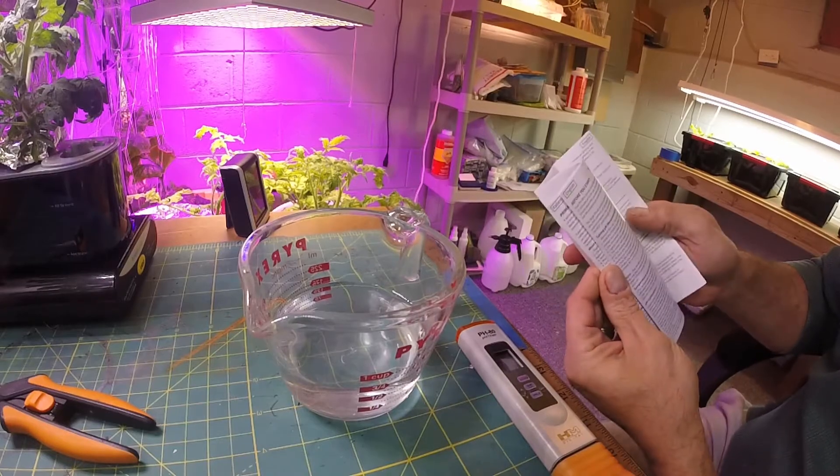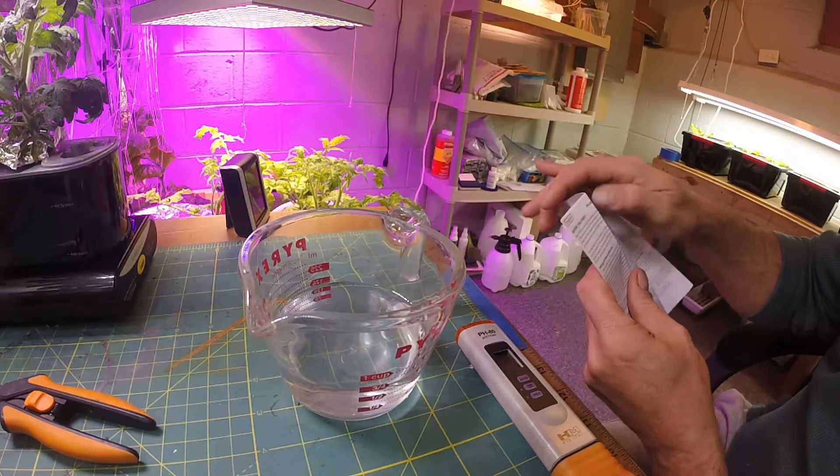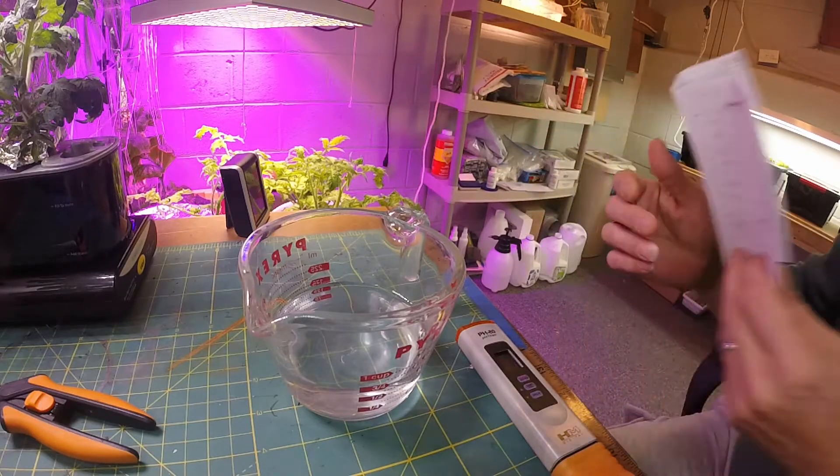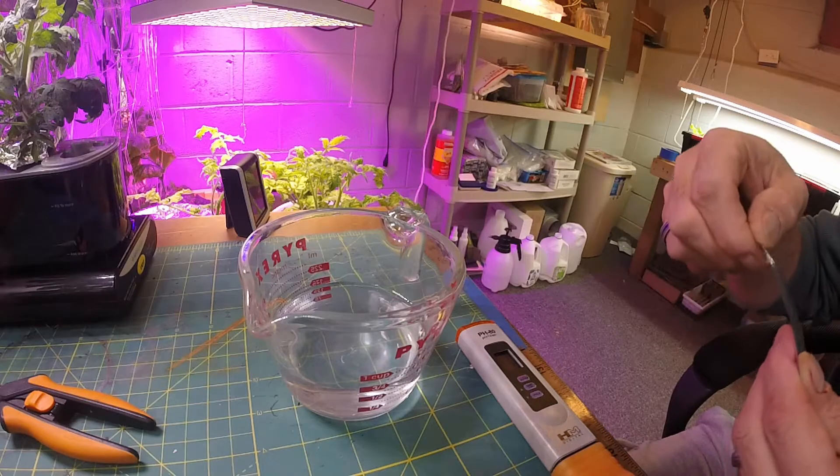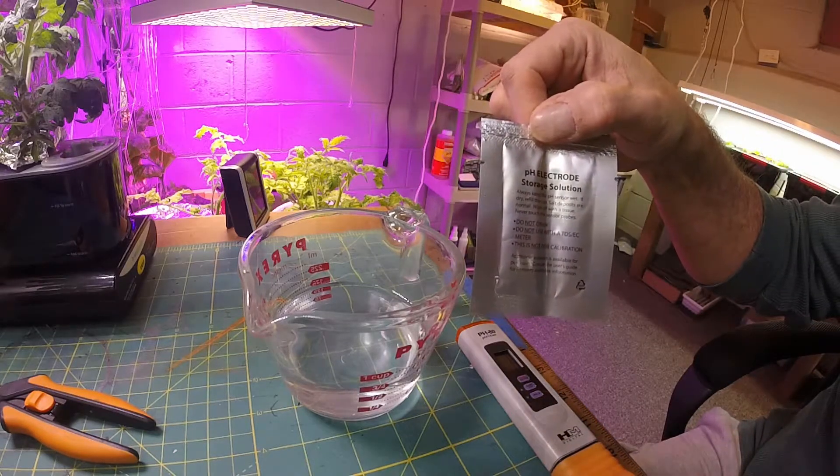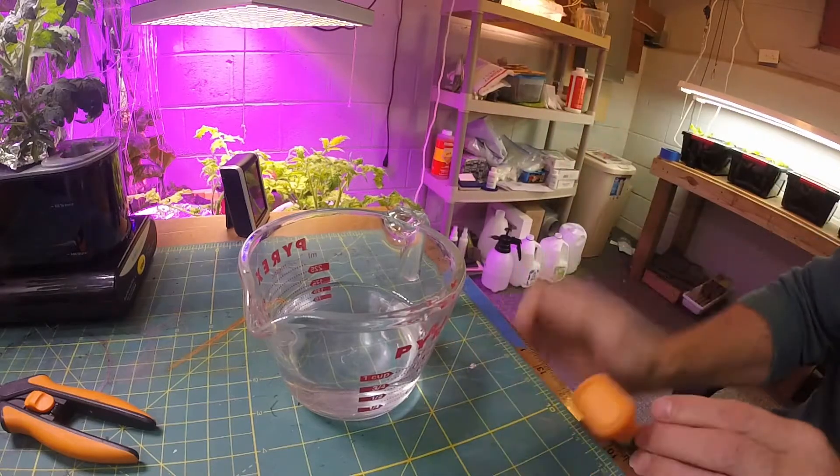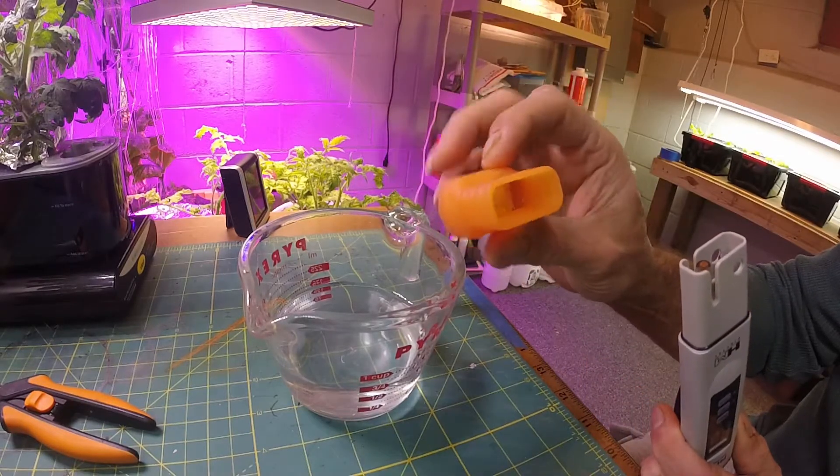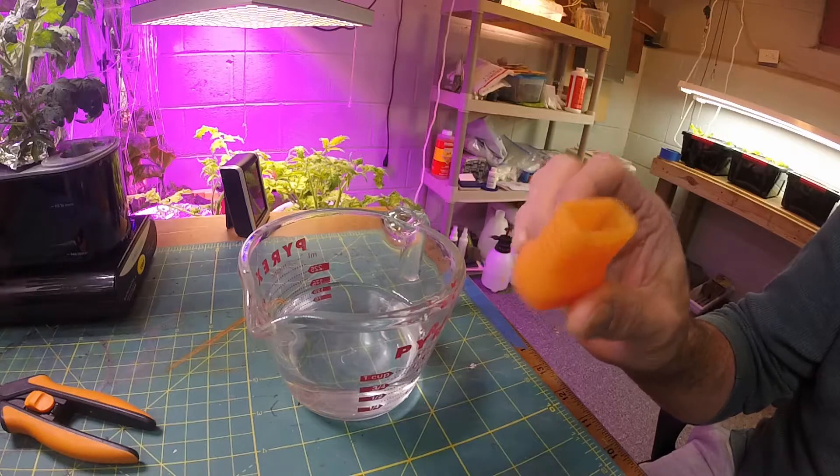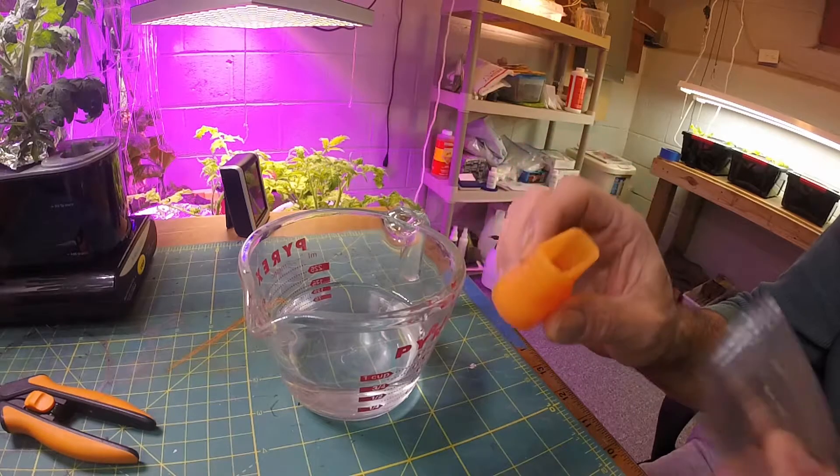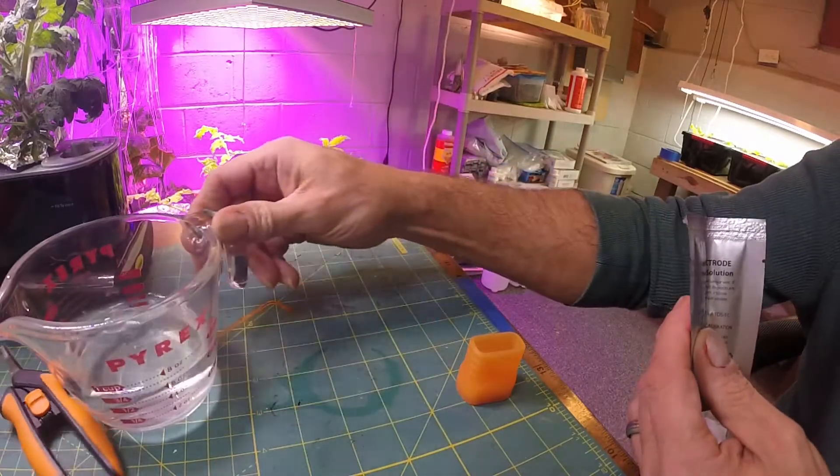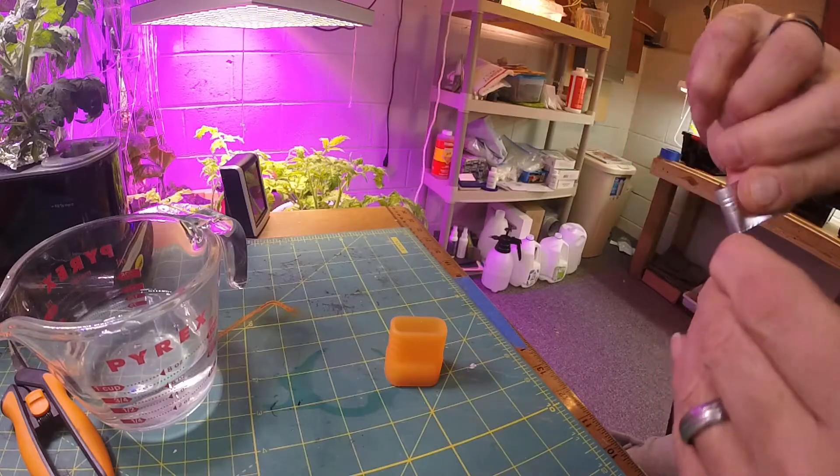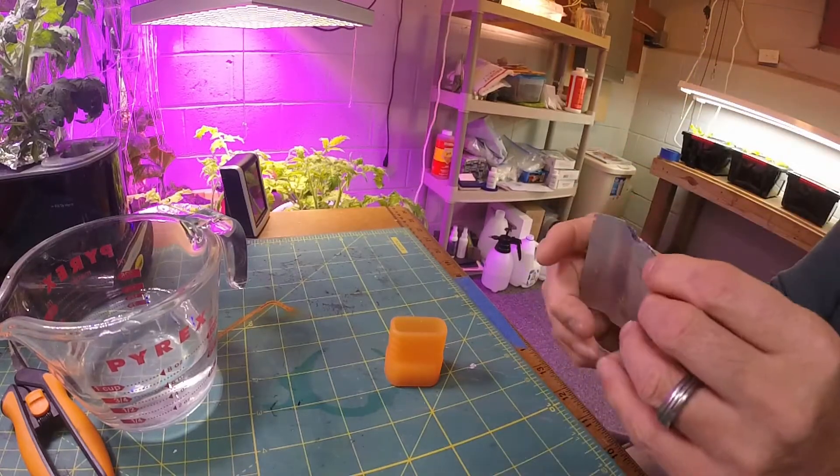I did open this so I didn't have to spend a lot of time reading through this while I was doing the video. This actually has to sit in solution, so it gives you a storage solution. The cap at the bottom actually acts as the storage solution holder. What they recommend you do is open this - I've got a cup of water just so I could test my tap water. What we're going to do is open this solution.